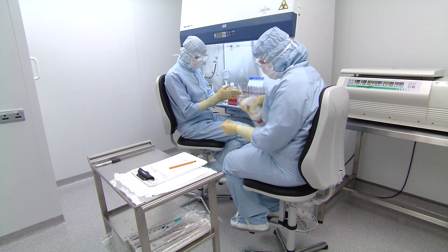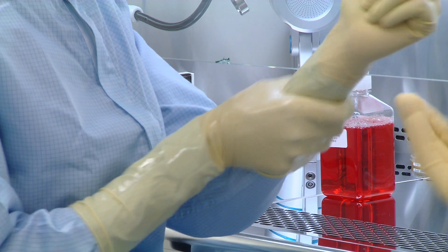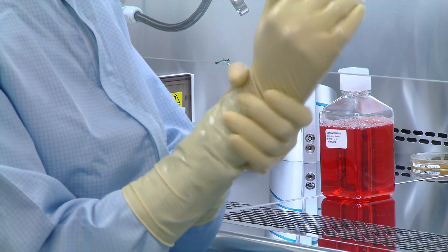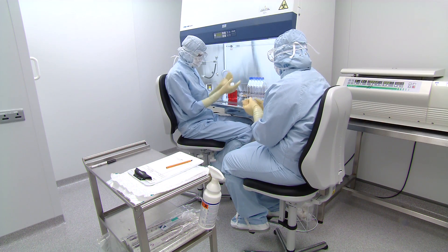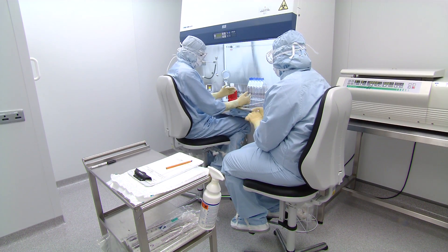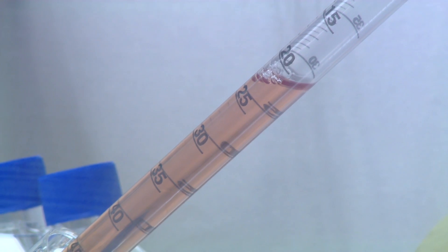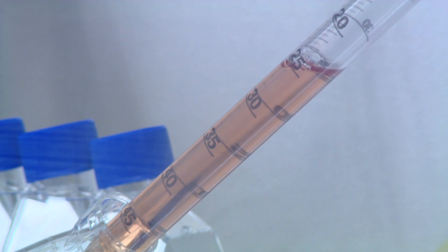The people who work in these areas have to gown up — they have to wear sterile gowns, masks, hoods, goggles and so on, where the intention is that the person will not contaminate the product or contaminate the area.